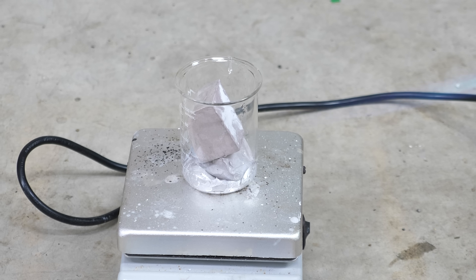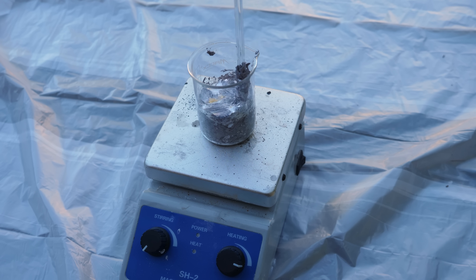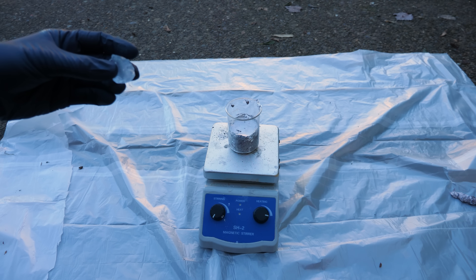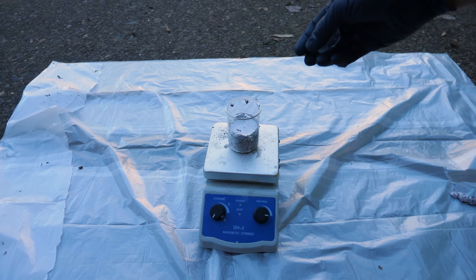There it goes. We got our molten sodium now. The shiny surface of the molten sodium quickly oxidizes in the outside air. Okay, here's my solid chunk of water in liquid sodium — three, two, one.